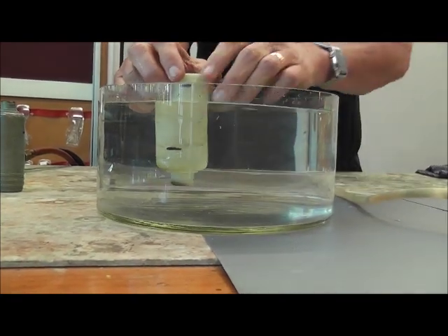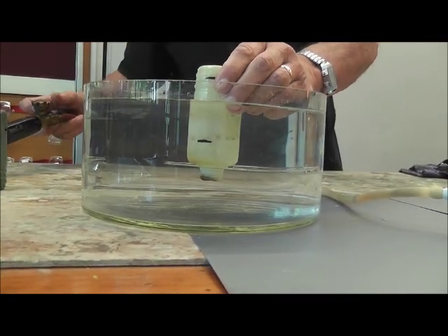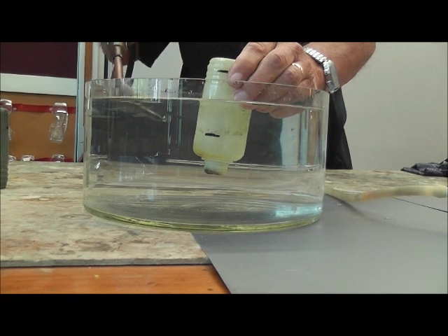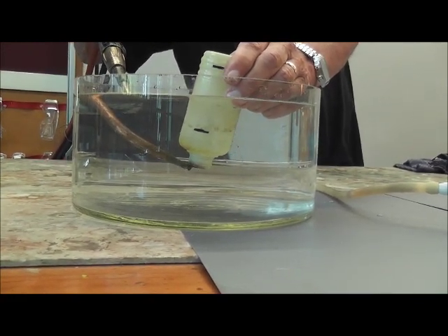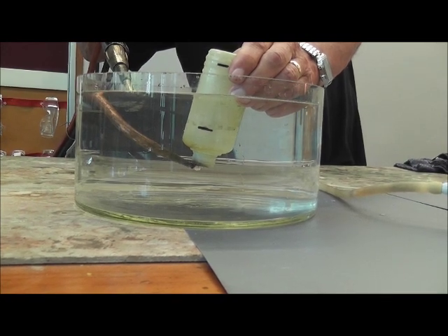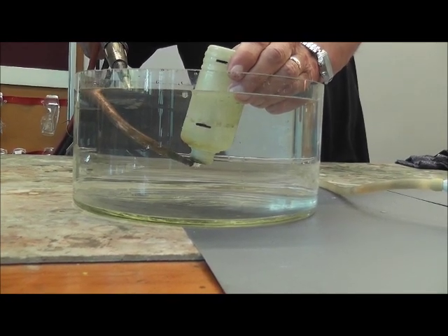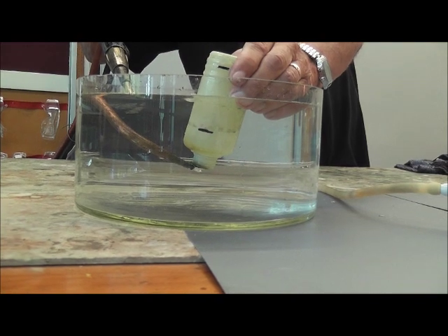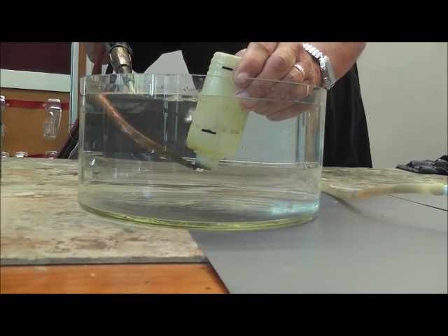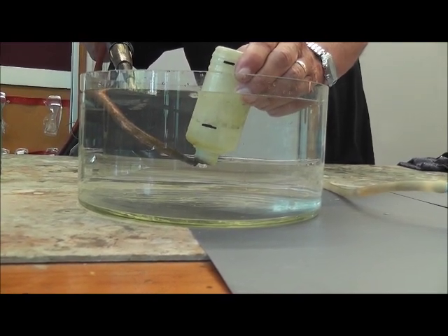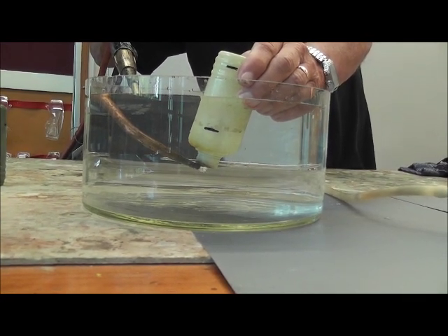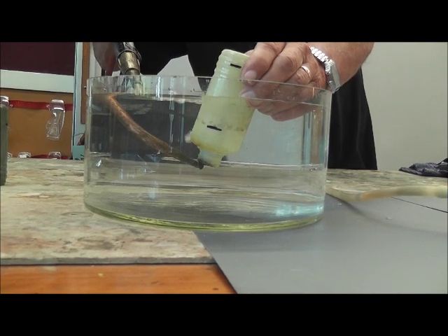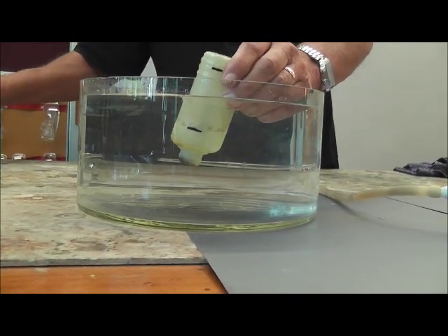Okay, there's propane. And what we'll do now is from a gas cylinder in which I have oxygen, we'll bubble some oxygen in there as well until we fill the thing right up. Now we all know that combustion involves oxygen, and so this time we're adding the oxygen right into the container. And very shortly the rest of it will be filled with oxygen, which I think is the case now.